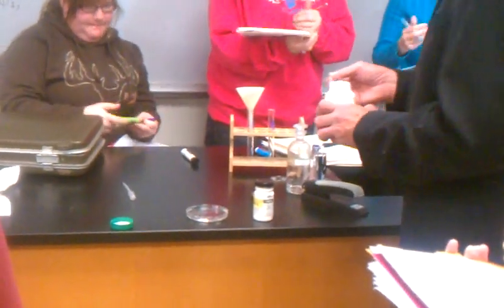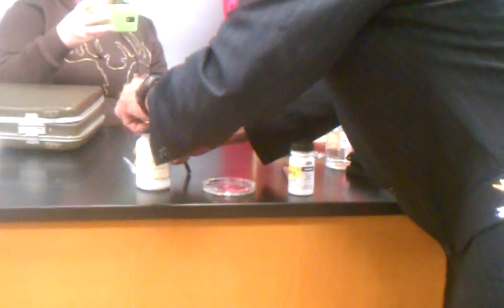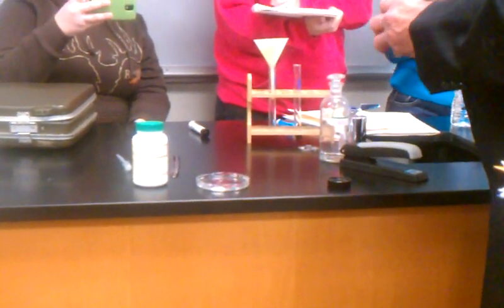As close to the edge as I can get, I'm going to put a little potassium iodide right there. And then, in addition, I'm going to go over here and put a little of my lead nitrate.